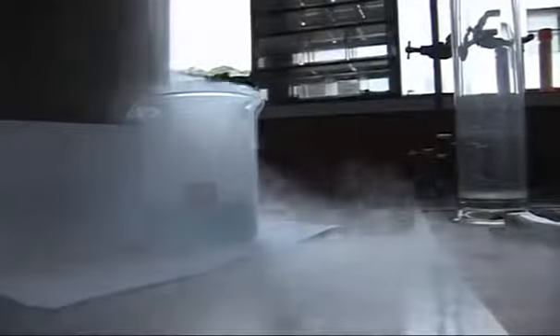So blue is often perceived to be the colour of solvated or unpaired electrons, and you can see here the lovely blue colour. Now, lots of chemists are really scared when they see the blue of liquid oxygen, because liquid oxygen is very, very reactive. Generally, you only make liquid oxygen by mistake. Not like today when we're making some on purpose.